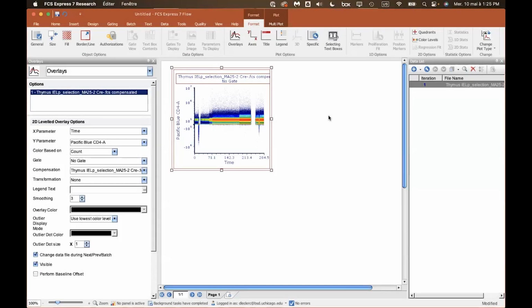Right, so we want to apply Flow AI on our data set in order to remove all this weirdness that occurs during the acquisition. We're using FCS Express today. We could use Omiq, we can use FlowJo. They all have the same group of algorithms that allow you to play with your data files. I find that FCS Express is a neat way to deal with it. Omiq, I'm just not as familiar with it just yet. And FlowJo has this weird system of plugins that I don't really enjoy playing with.